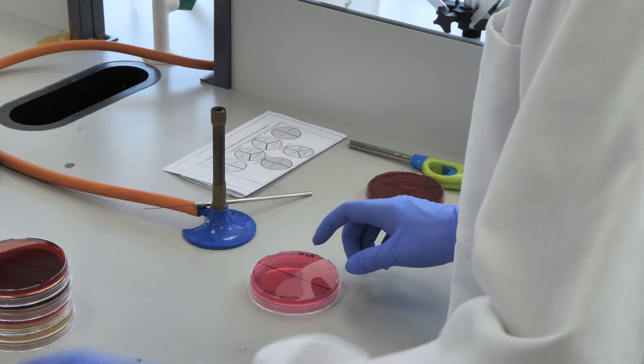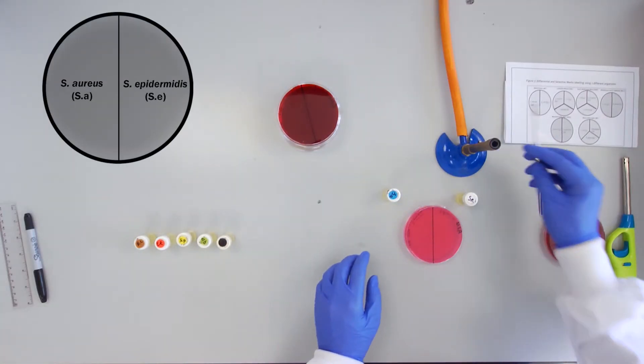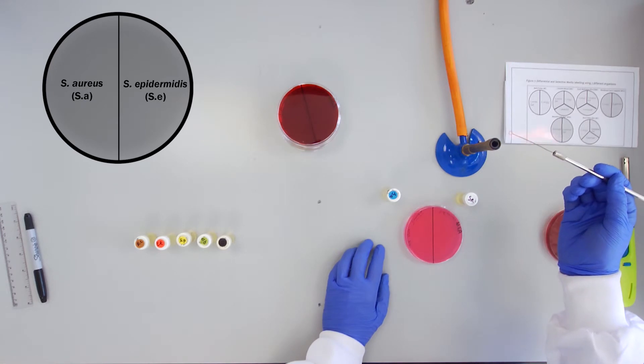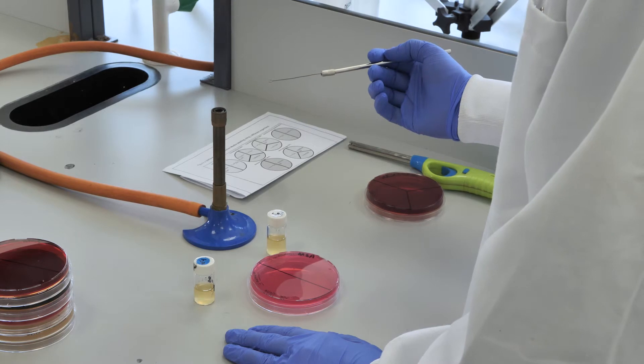The mannitol salt agar or MSA is pinkish red and will be inoculated with Staphylococcus aureus and Staphylococcus epidermidis.